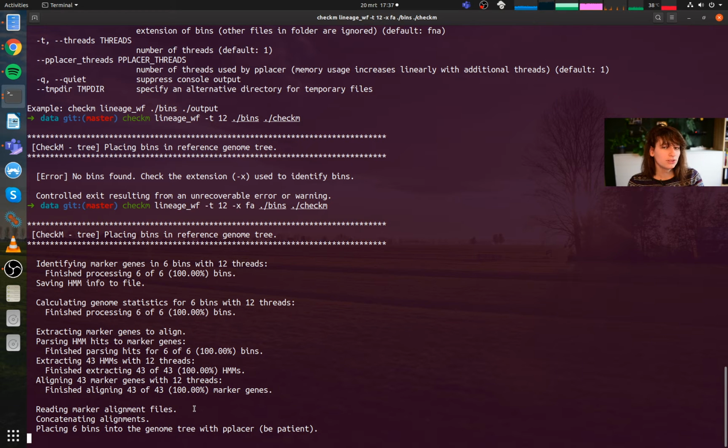So what it can do with these genes, a list of genes for each of these taxonomic groups, it can find out if these genes are present, which tells you about the completeness of your bin. If you're missing half of these genes that should always be there, odds are that you're missing half of your genome. If you find everything twice and you know of these genes that they should only be there once, then you know that you likely have two genomes in your bin that cannot be differentiated properly. So MetaBAT felt that these were the same and put them in one bin. So that's what CheckM does for you.